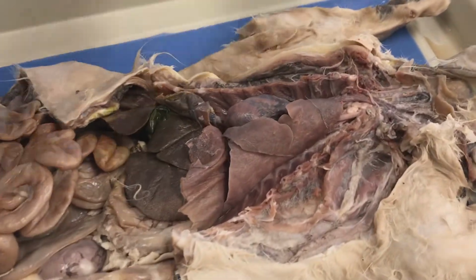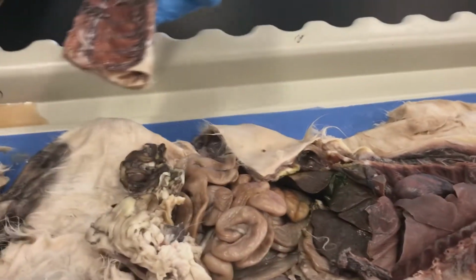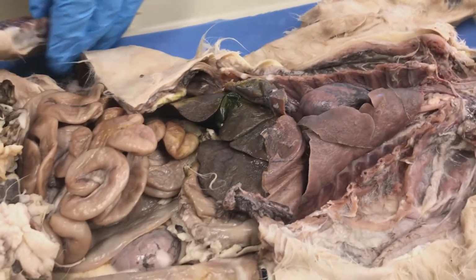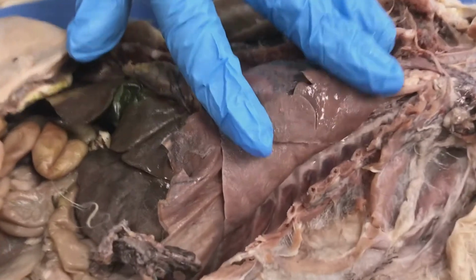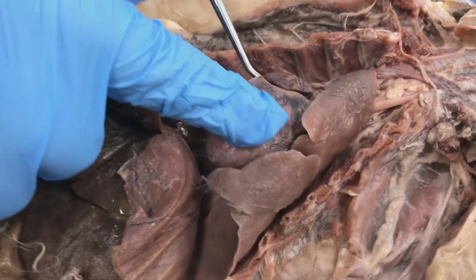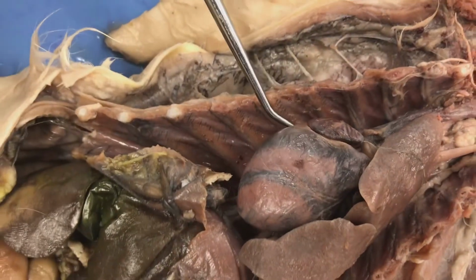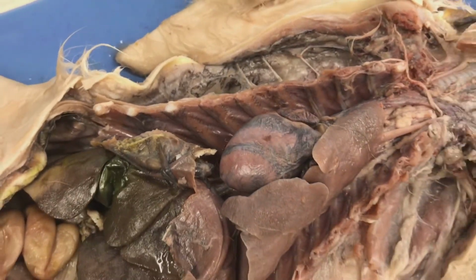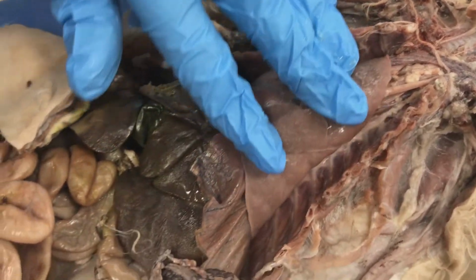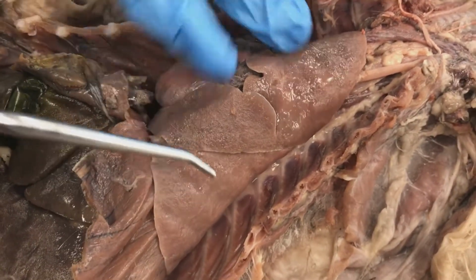So they have removed it like this. And they have removed this rib cage. So as we're first opening up the chest, we have the lungs on the centermost portion here, and this one they took out the right lung on this side. So we'll go ahead and talk about the structures one at a time. On this side you're going to have the left lung, and we're going to look at the lungs side by side in a little bit, with the heart in between.